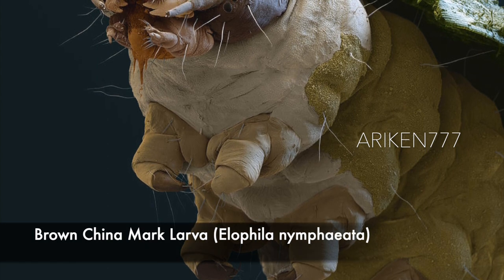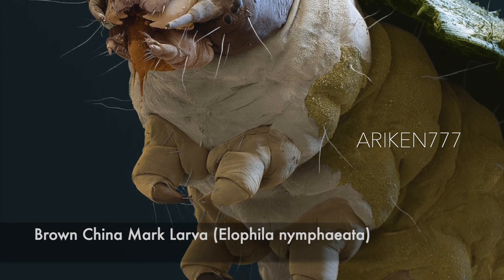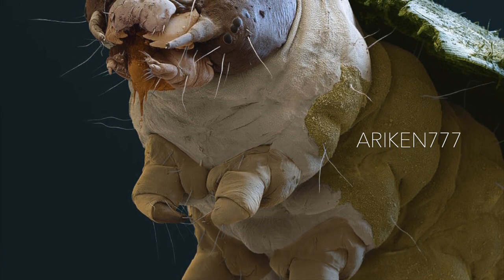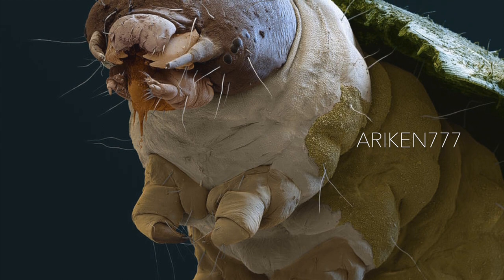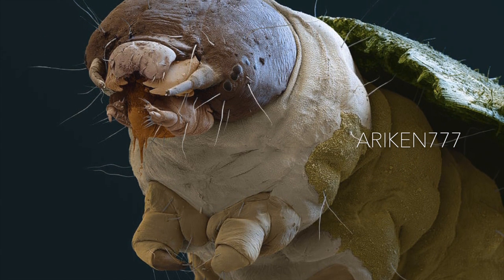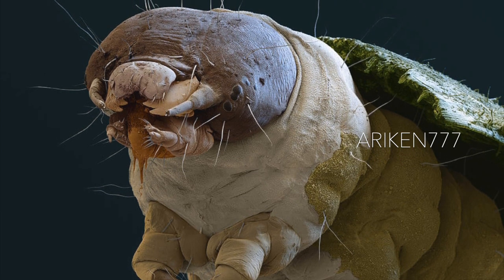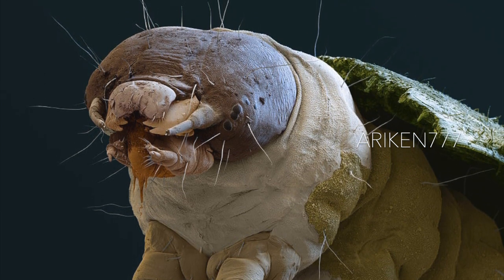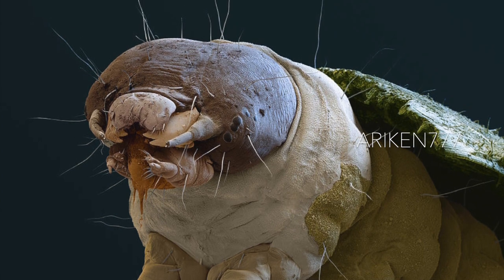The larvae of a brown China mark, a species of moth. This species is found in Europe and across the Palearctic to the Russian Far East and China. These moths are unusual in that their larvae are entirely aquatic and have tracheal gills. While in water, they protect their soft caterpillar bodies with bits of leaves which they weave together.